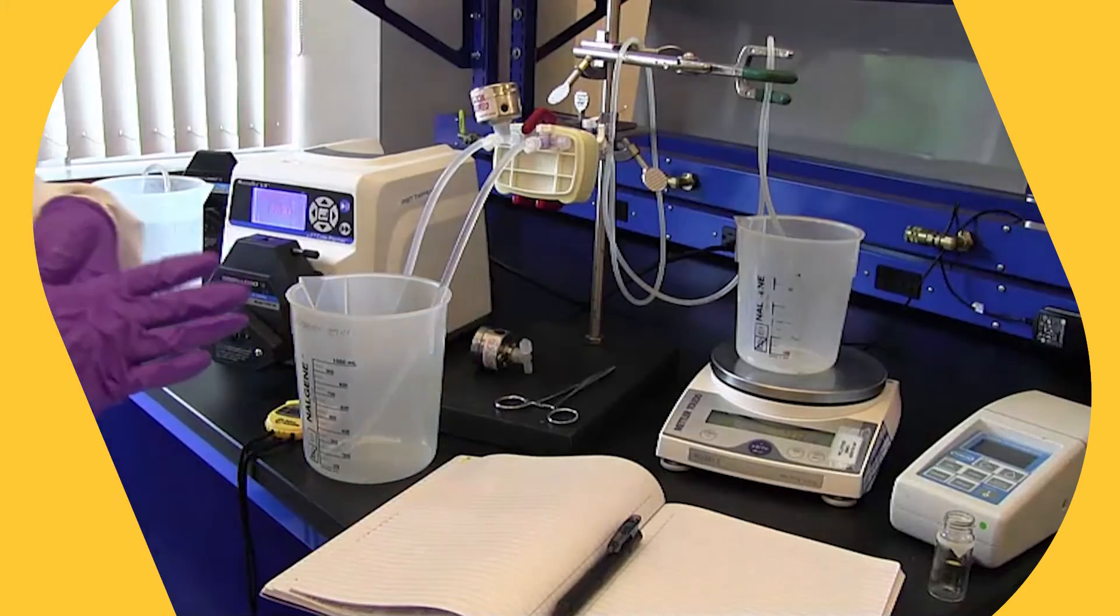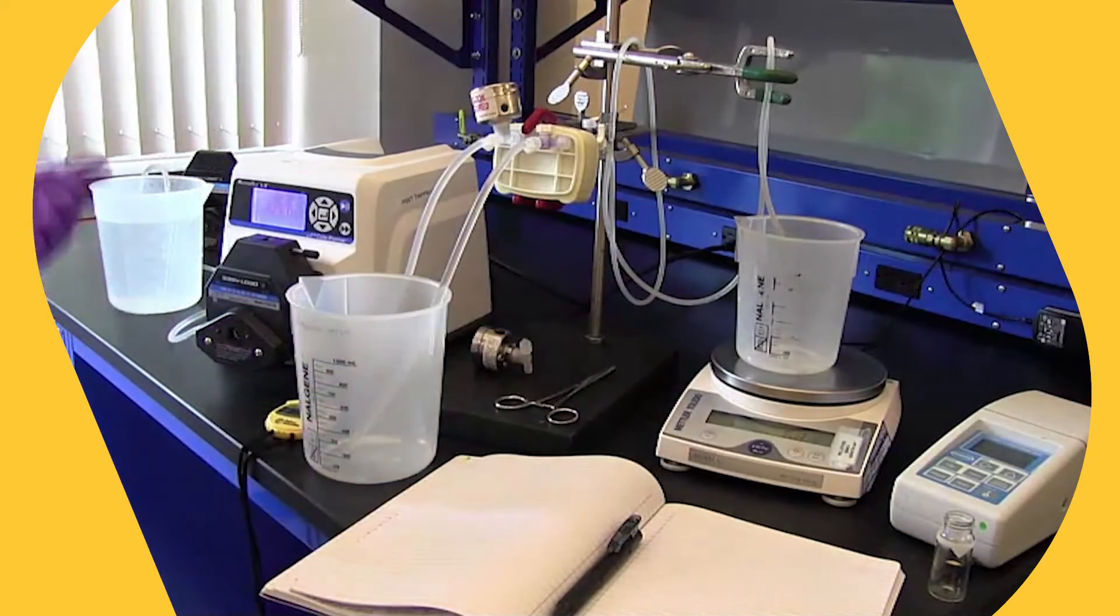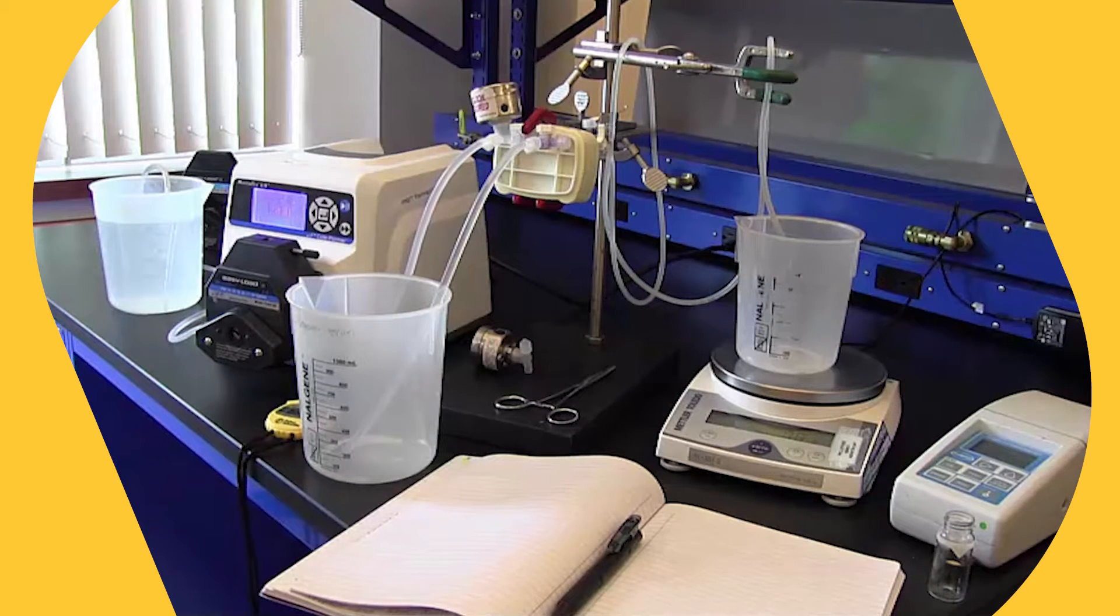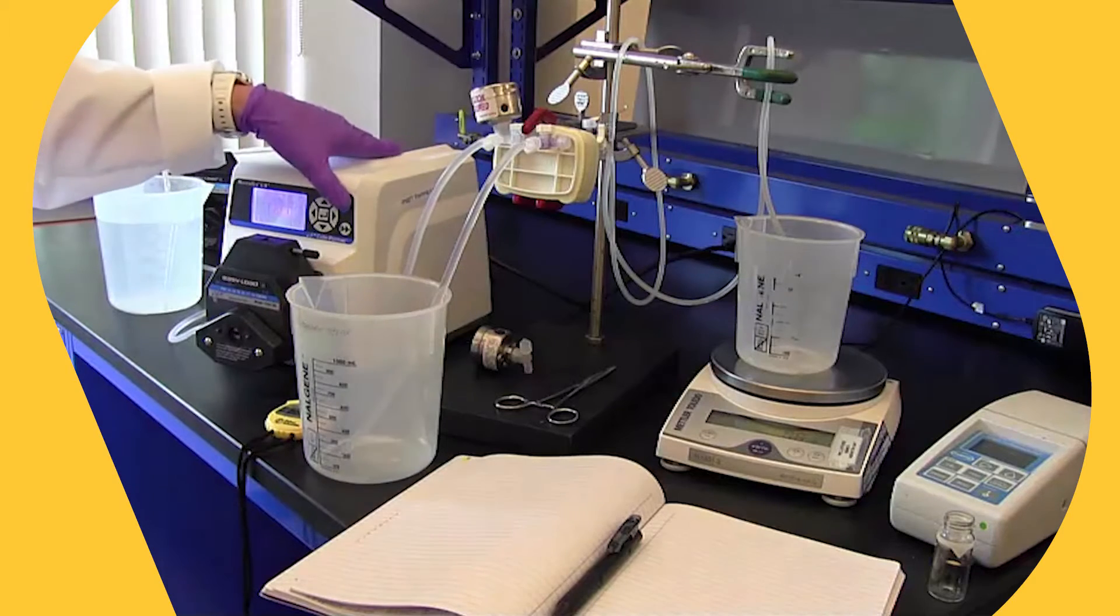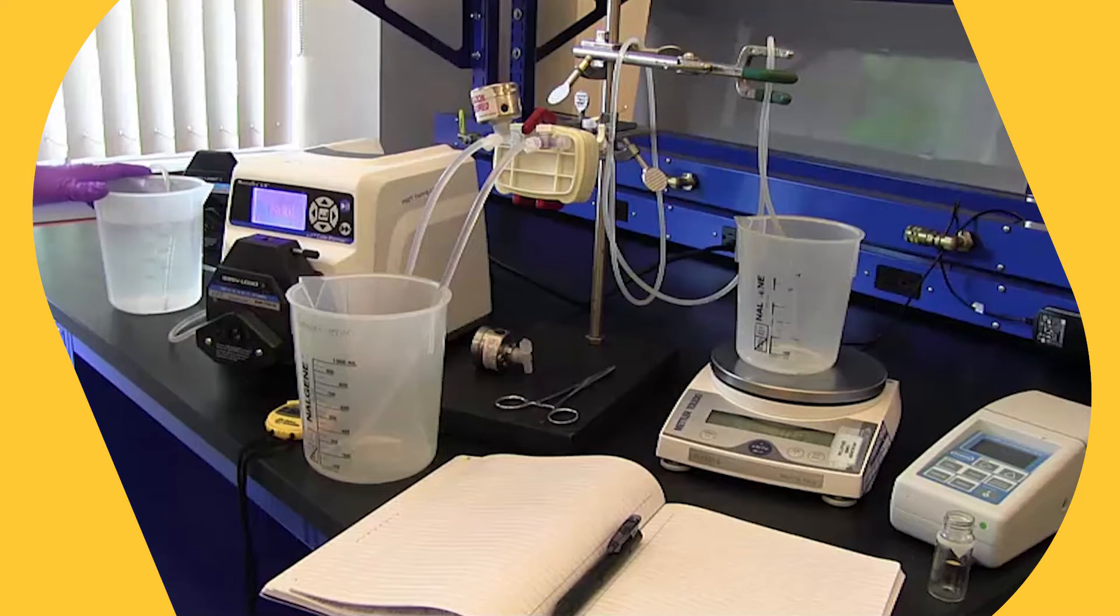So again, for the sake of the video, we will not fill this all the way up to 230 mils because we are going to use water in place of our product. But once you would reach the 230 milliliter mark, you would stop the pump, you would discard your material, you would dump your water here, and then you would fill this with product.